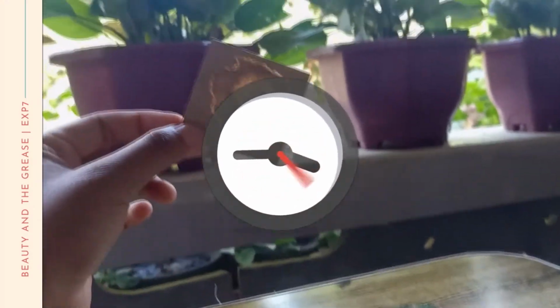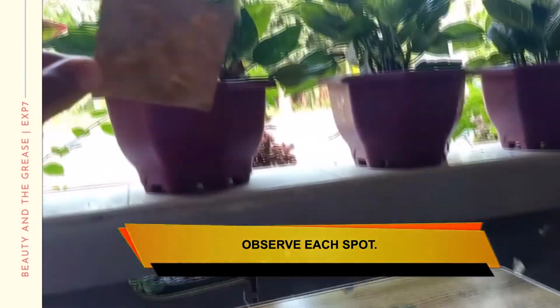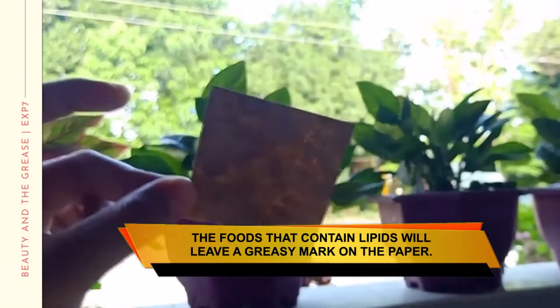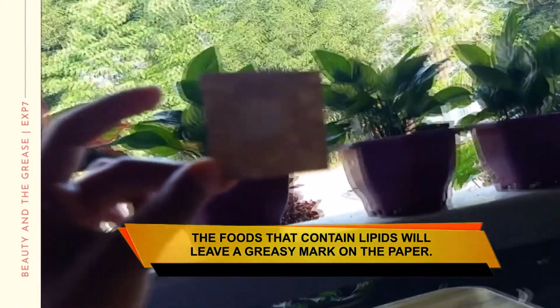After drying the paper, hold each paper up against the light and observe each spot. The foods that contain lipids will leave a greasy mark on the paper.